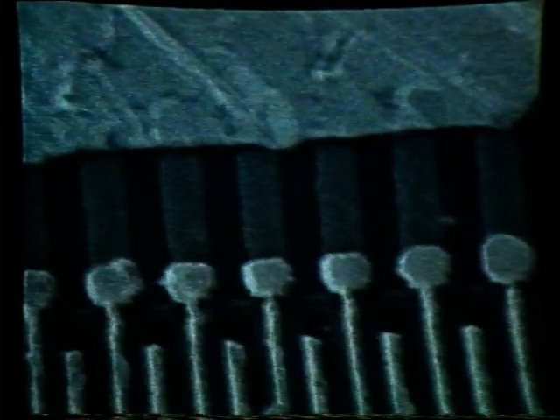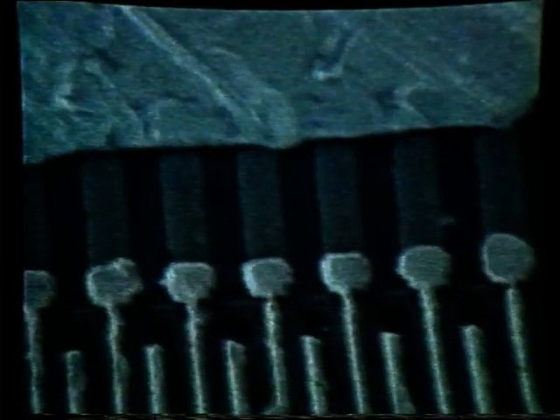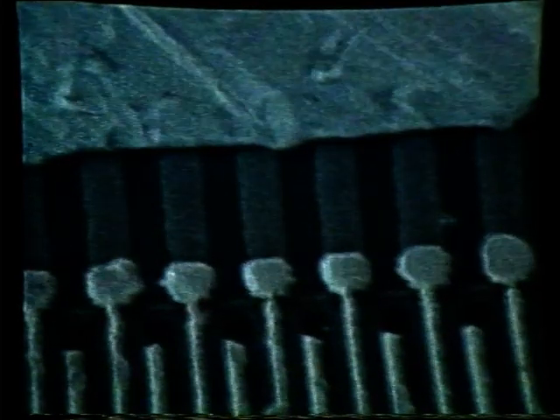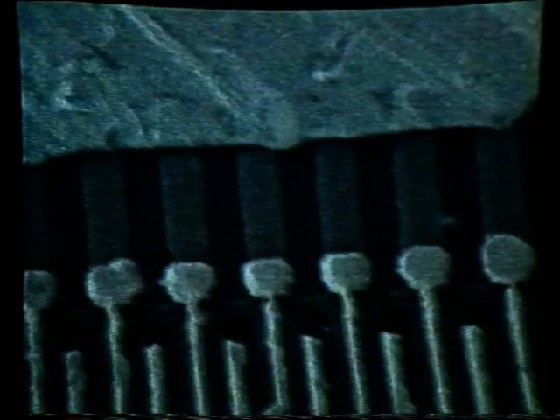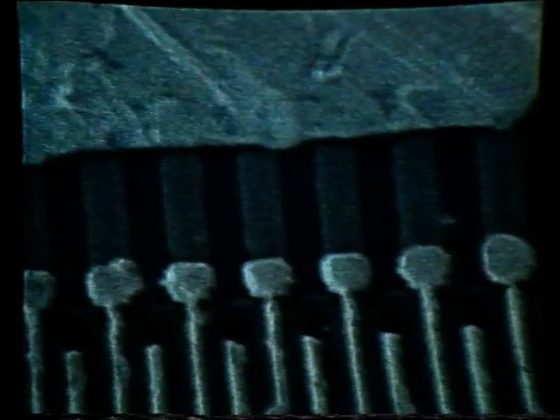Not all electron gun filaments will operate exactly the same. Most electron gun filaments operate with an optimum emission current set at 100 microamps, which is where we have our set at this time. Some filaments operating at that emission current will have multiple emission points. This filament in the electron gun has multiple emission points. We can see double imaging.